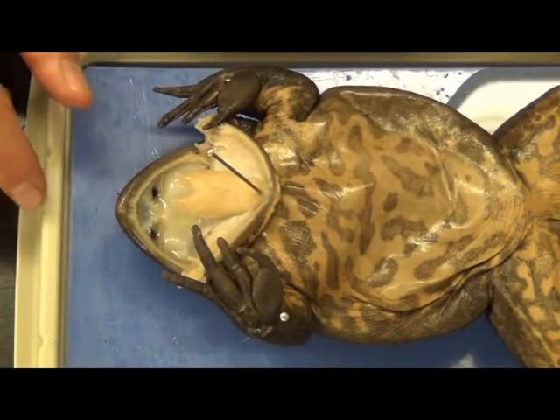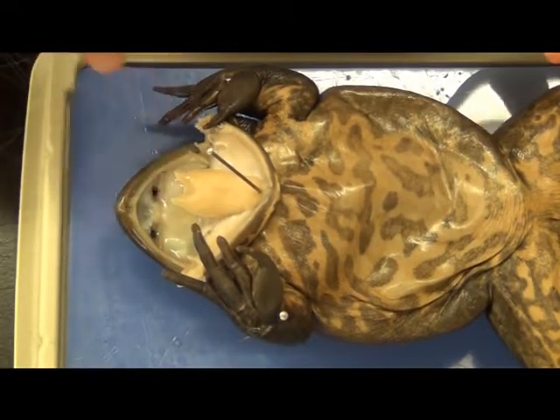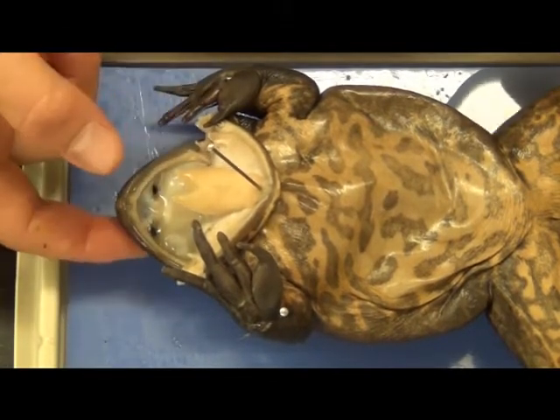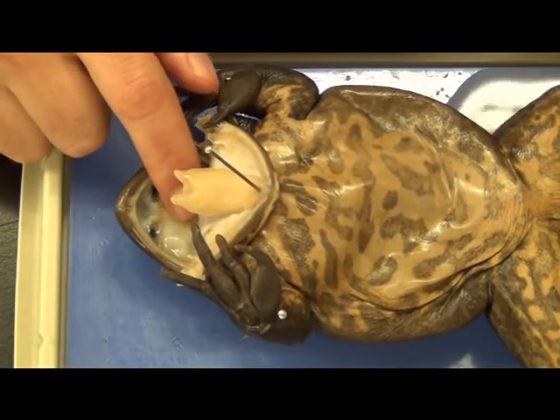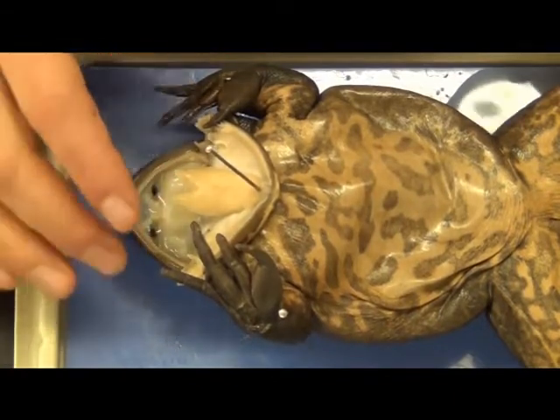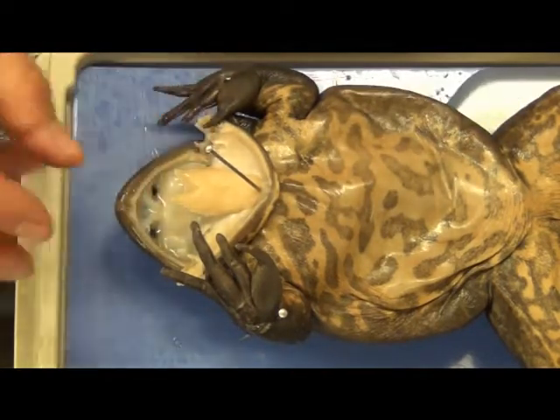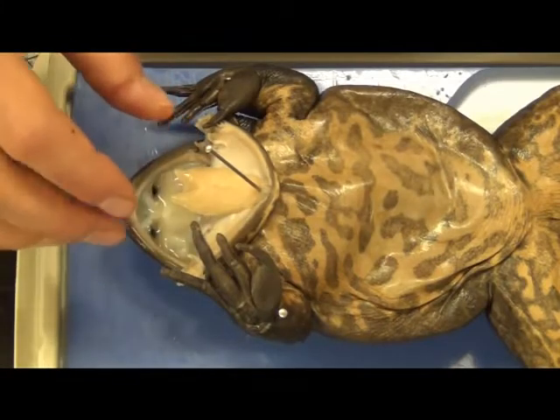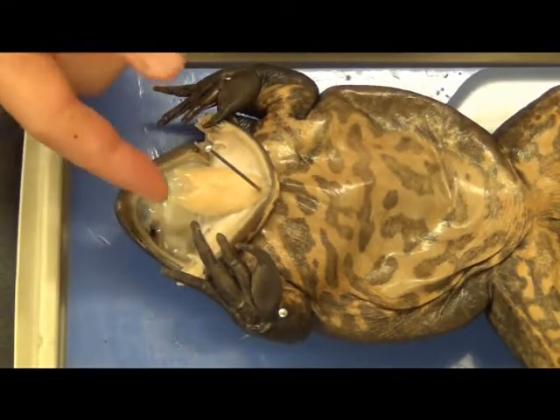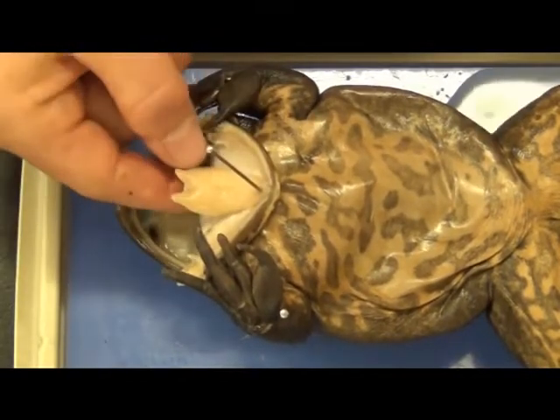Let's look at some of the parts and pieces. With the external nostrils — we had external nares — and inside of here you can see two holes. Those are the internal nares; they actually have a breathing apparatus to the nostril entering through the top of the mouth. You also have this interesting tongue right here. This frog is a super carnivore, and just about every part and piece is designed to allow prey to go inside and really discourage it from being able to come back out. The tongue folds forward, sometimes it's got a bit of sticky on it, and it's meant to grab, pull, and bring the prey inside.